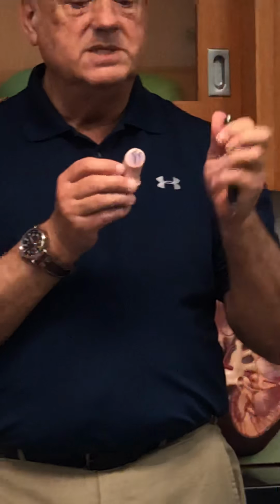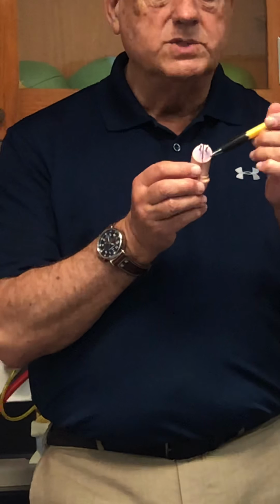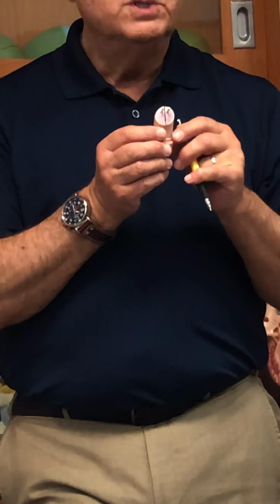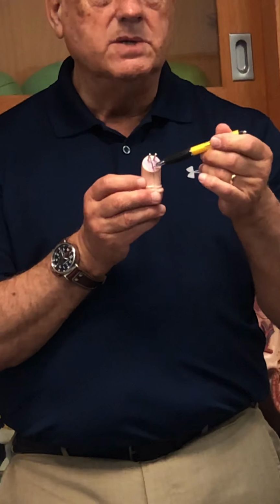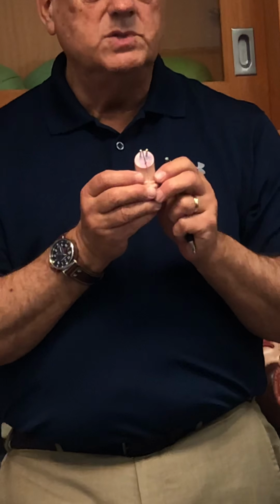All right, so we now remove the penis. When we take a look inside, we can see these blue structures. Again, those are the structures that will engorge in blood to allow for an erection to take place. What are those structures called? Corpora cavernosa. Okay. So we don't want the spongy urethra to collapse under the weight of all that blood. So it also has spongy material around the urethra. What's that called? That's called corpus spongiosum, right?